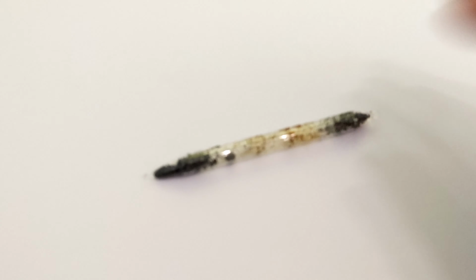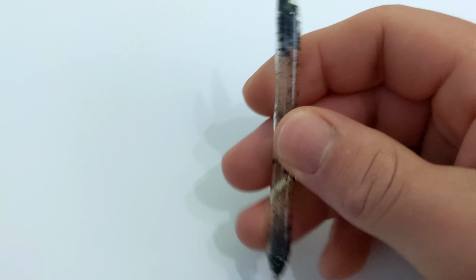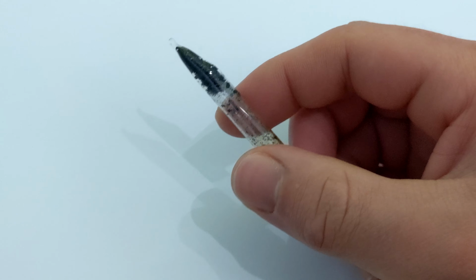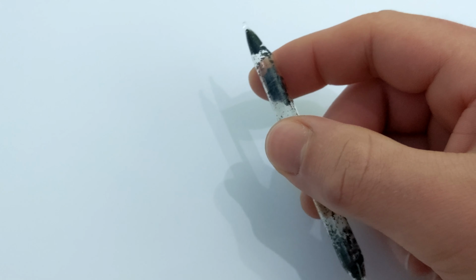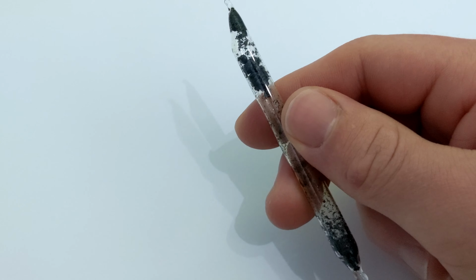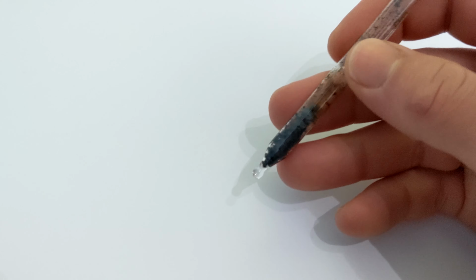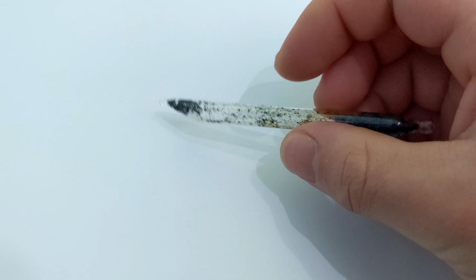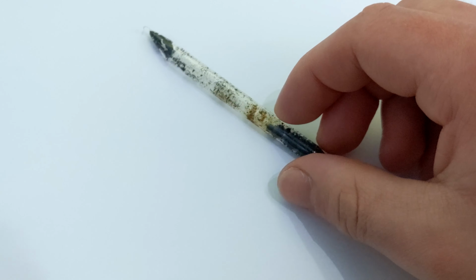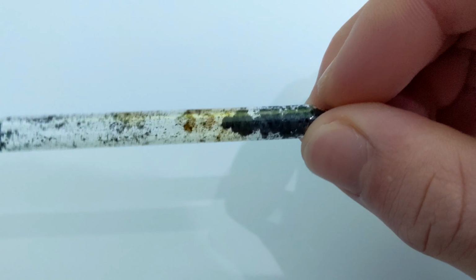And here you see the final product. This is the ampule of iodine I made. Now it is very wet because, again, good old British weather. And I love the way it looks. It has a dark grey purple metallic sheen to it. I think it's pretty cool. The sample's not very dry or pure, but this is solid elemental iodine that I made.